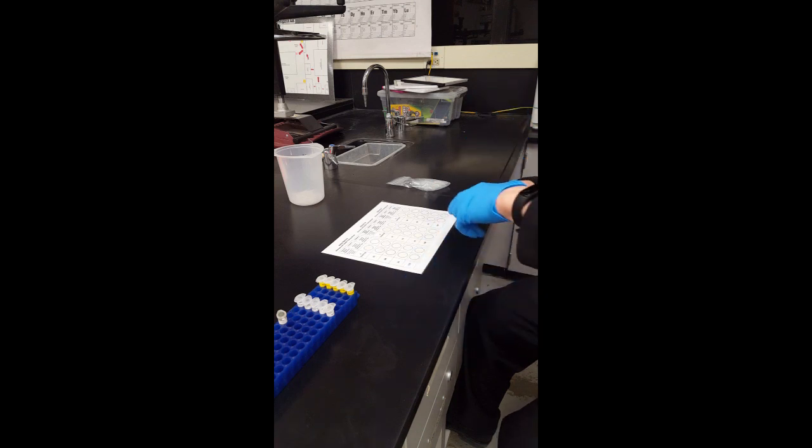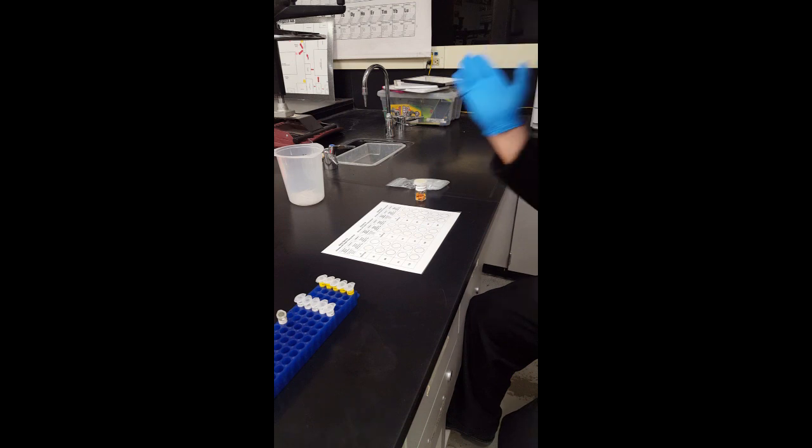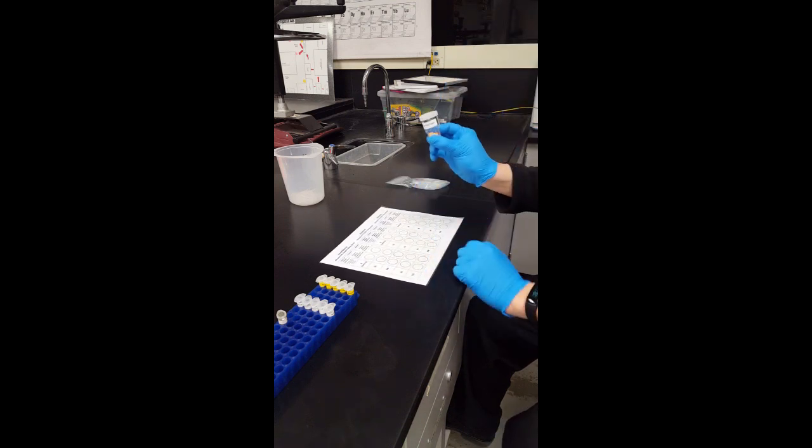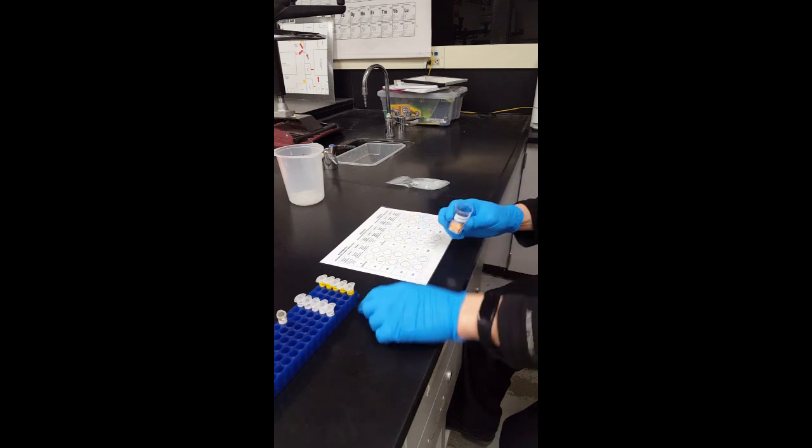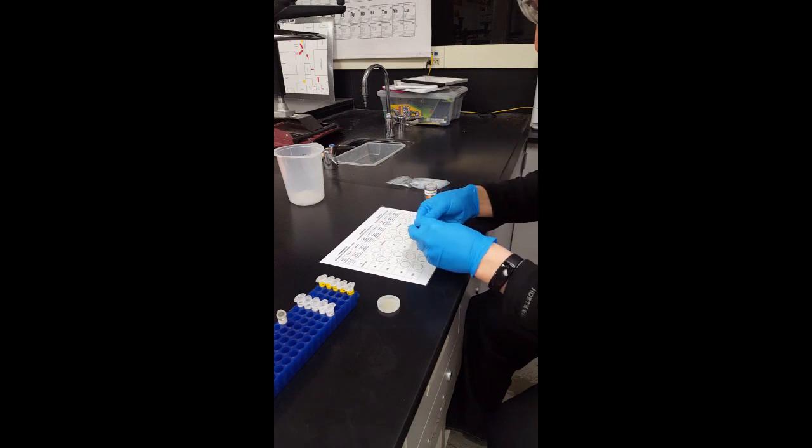So what you want to do first is gloves, goggles, safety equipment of course. Then get your glucose test paper strips and we're going to start with Ana Garcia first.